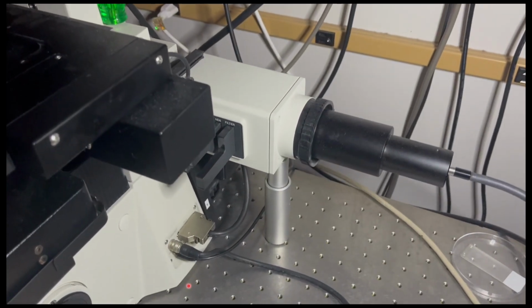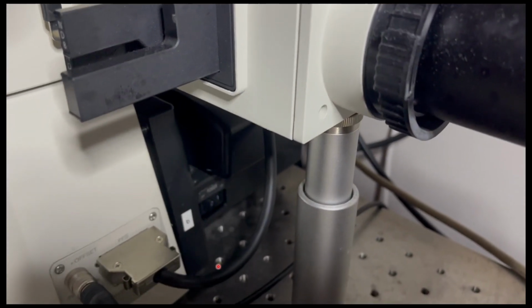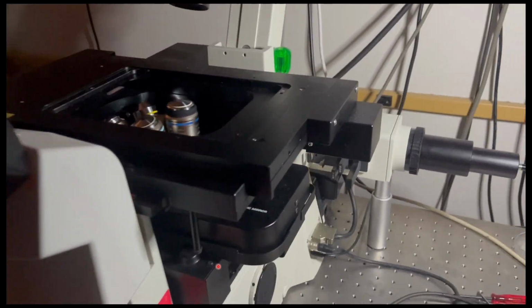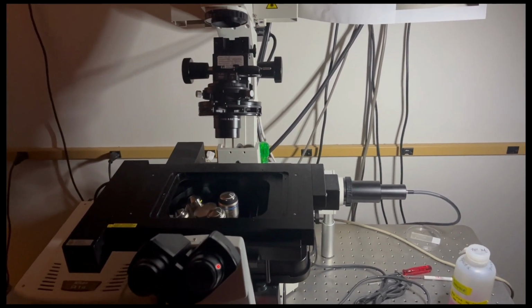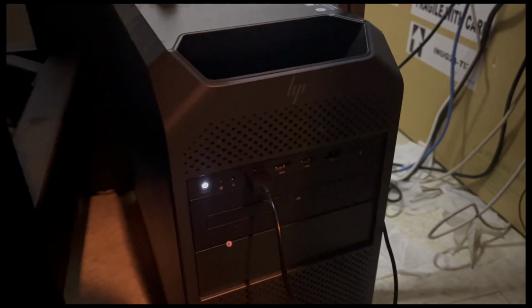The last thing that gets turned on is the microscope itself. It is a button back here. It is a little bit tricky to see, so I would suggest for your first few times actually using a flashlight on your phone to help you locate it. Finally, the last thing you'll turn on is the computer. The computer is sometimes left on and it is sometimes off. If it's on or if it's off, you can just switch it on here.